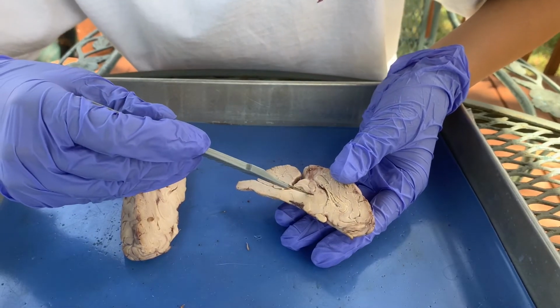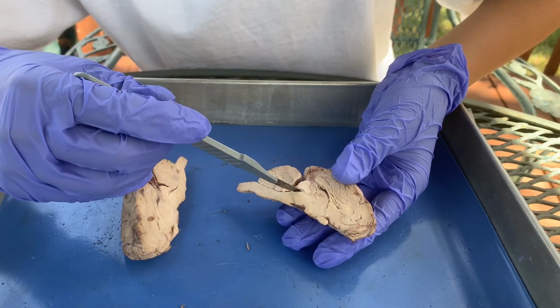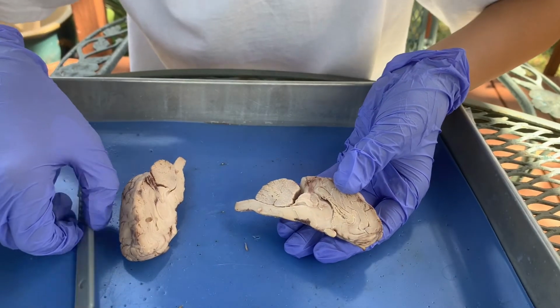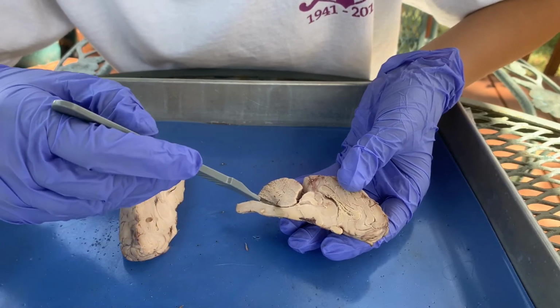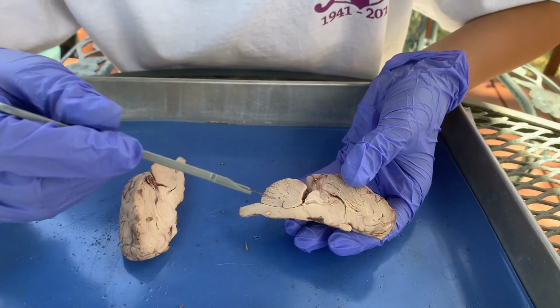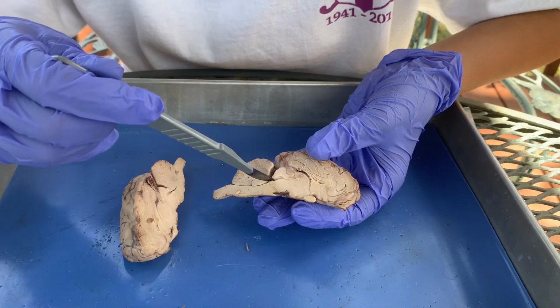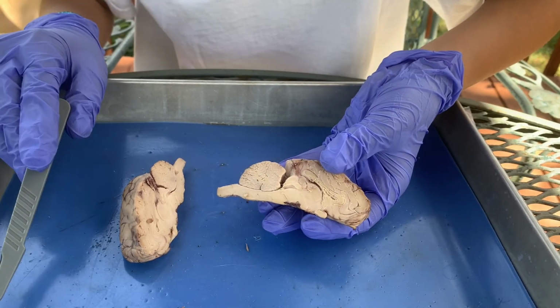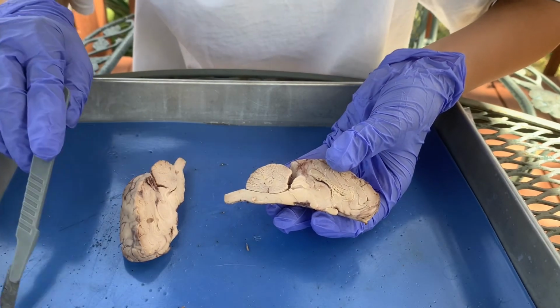And then the cerebrospinal fluid goes here, and down this cerebral aqueduct right here. The CSF, or cerebrospinal fluid, would go down this aqueduct and into the fourth ventricle right here. So the connection between the third and fourth ventricle is this aqueduct right here. I'm tracing it, and then that is the fourth ventricle. And then it would continue going down into the central canal of the spinal cord.